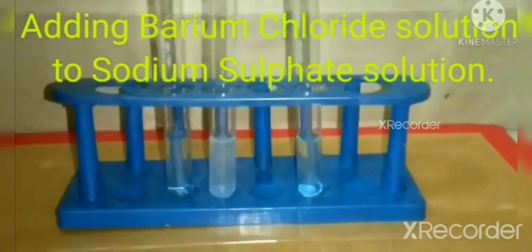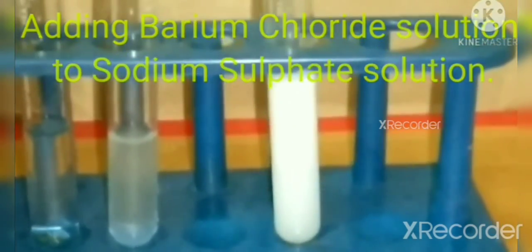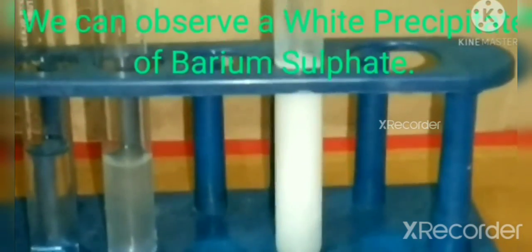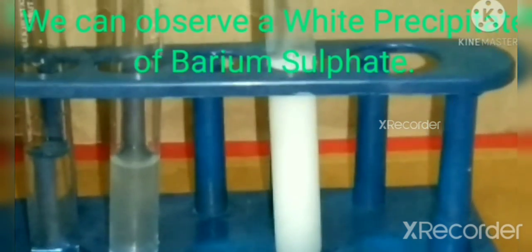Now adding barium chloride solution to sodium sulfate solution, a white color precipitate is formed. See here, this white precipitate is formed now. So this is the fourth experiment.